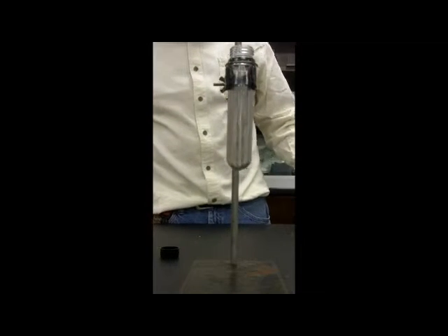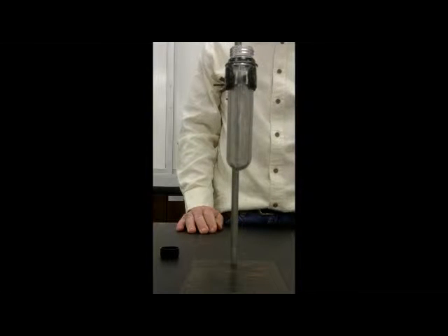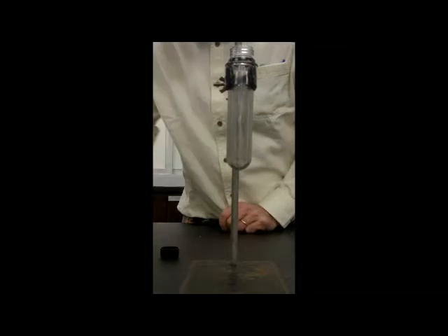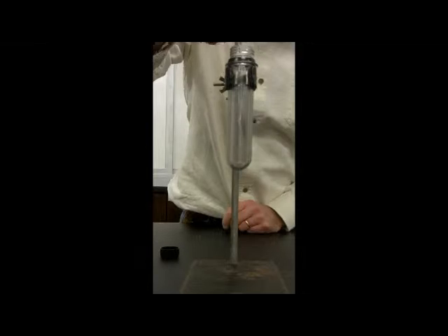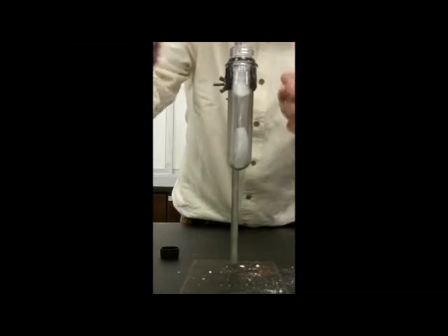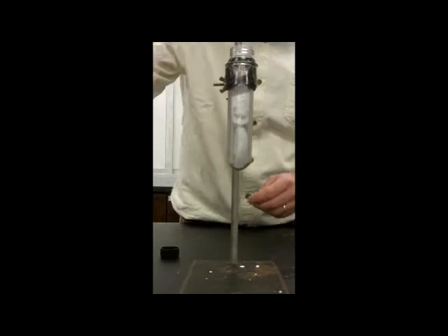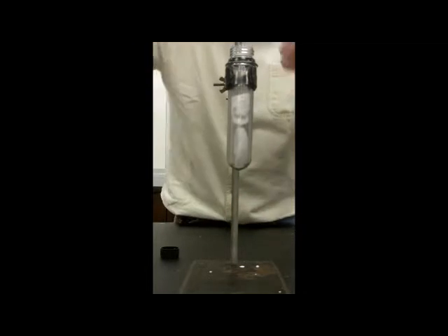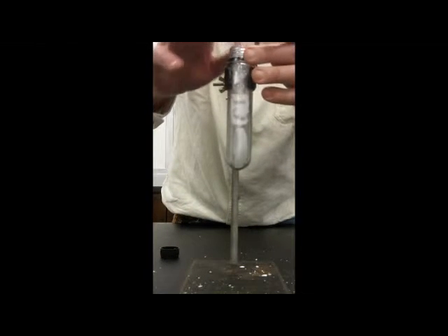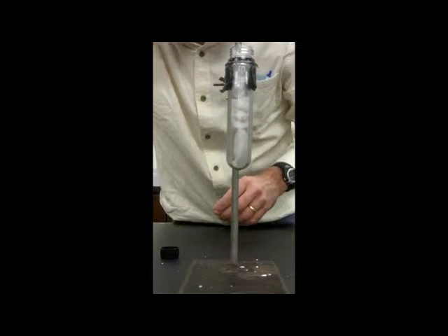So the uses for dry ice, I should say, in the lecture are a lot. I've got a few examples here. One is I've got a little plastic container, and I can throw the dry ice in there. Dry ice, of course, has this fantastic property that it's always a solid or a gas, but never a liquid. That's why they call it dry, and it looks fascinating that something never ever melts.